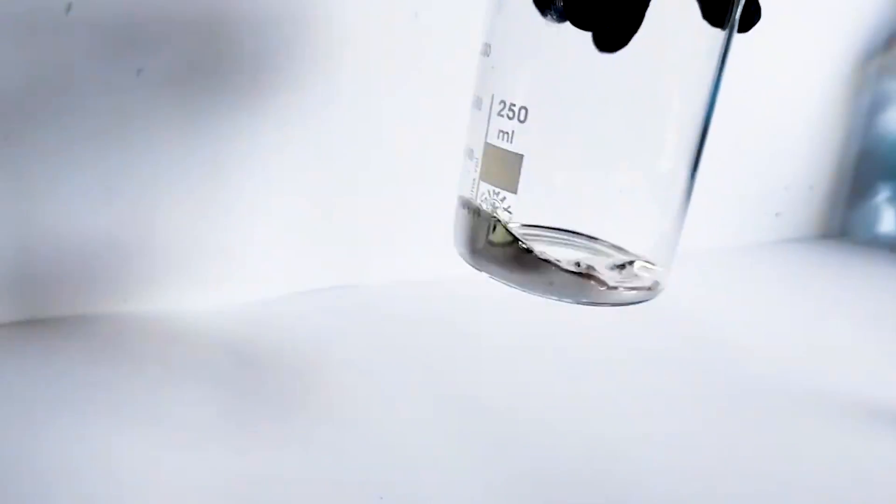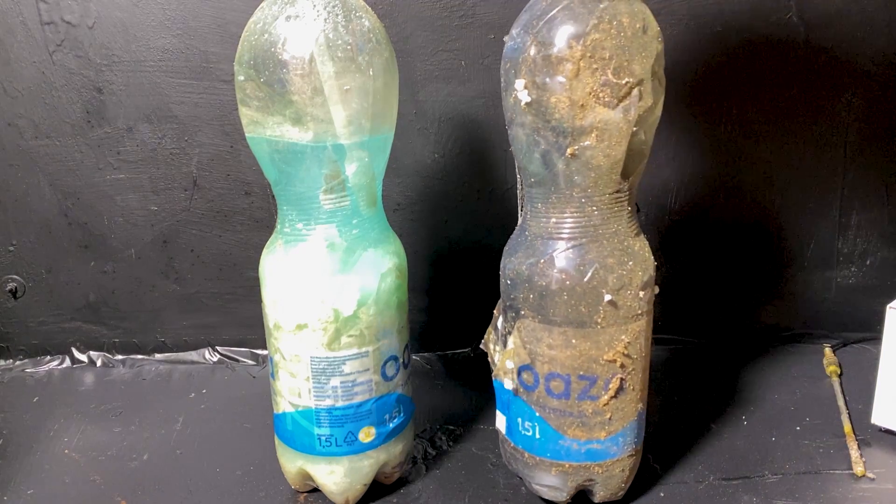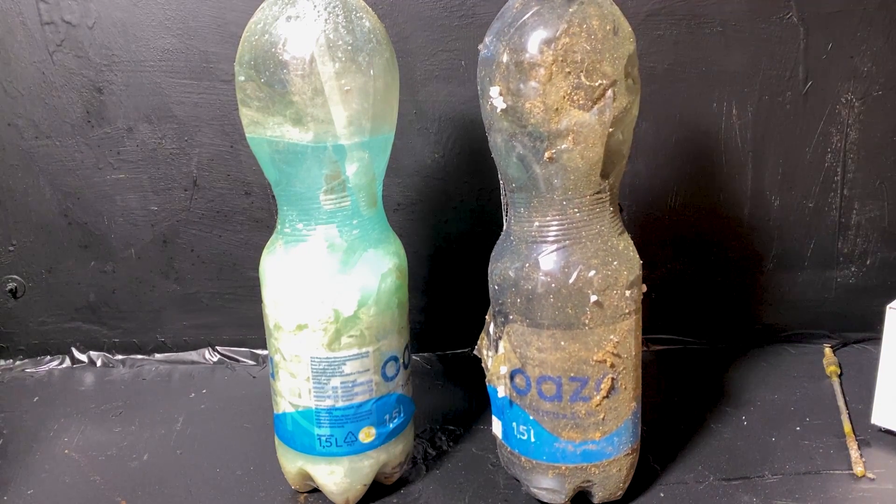In the past two years, I've done a bunch of experiments with mercury and its salts. And these experiments produced a bunch of toxic mercury waste, which I now have to take care of.